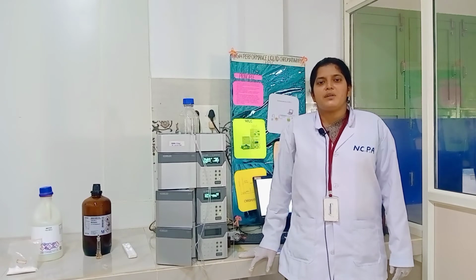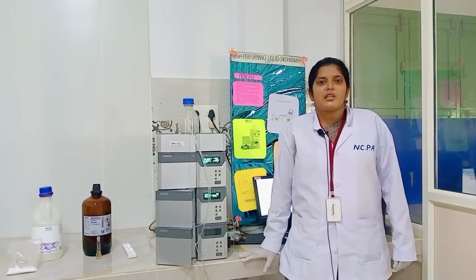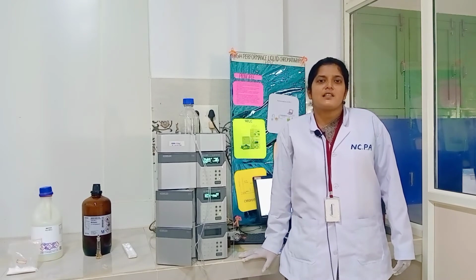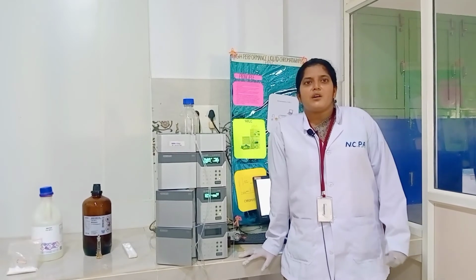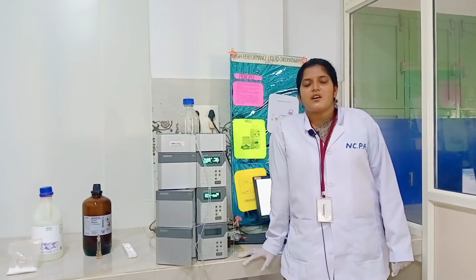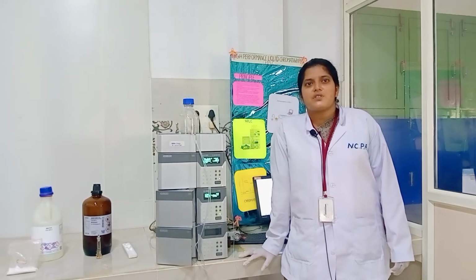Applications of HPLC: being a sensitive and versatile technique, HPLC is used in a wide variety of industries. Apart from the pharmaceutical industry, it is used in the chemical and petrochemical industry, in forensic applications, and in environmental applications. It is also used in the biochemical industry, for separation of components in biotechnology, and for the estimation of compounds in these fields by qualitative and quantitative analysis.